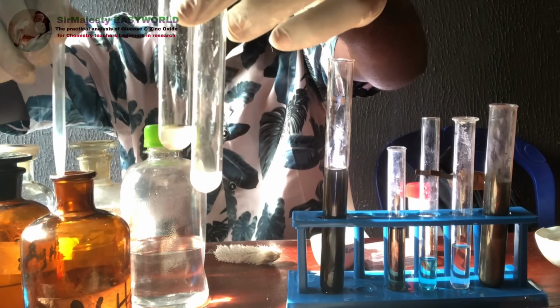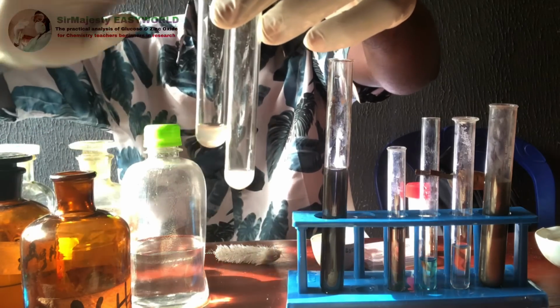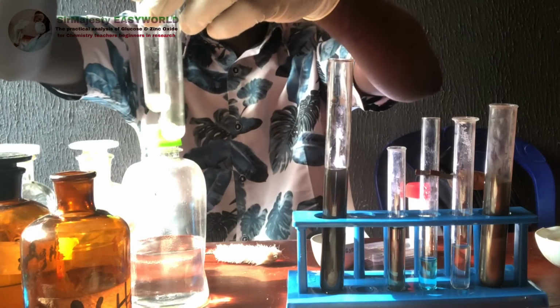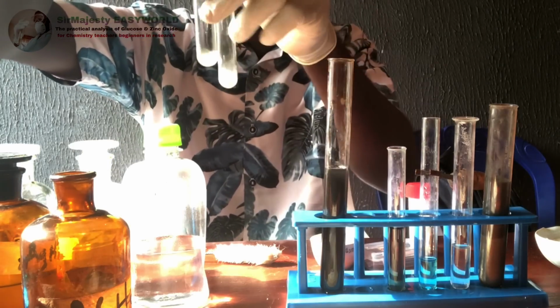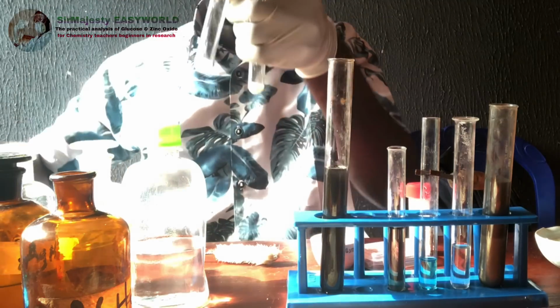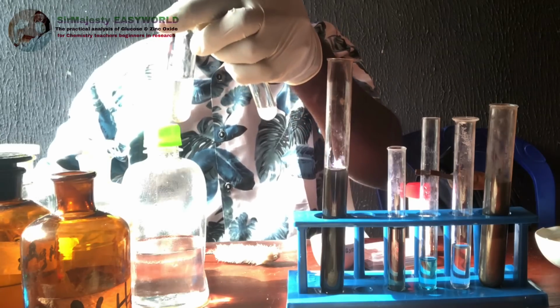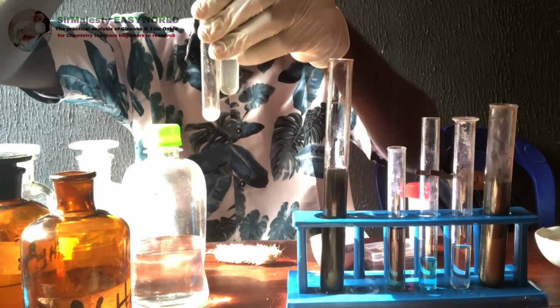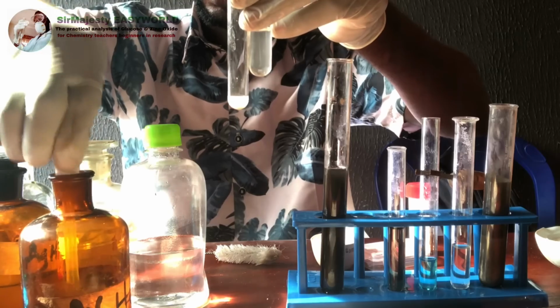So if you are required to add HCl to zinc oxide or any dilute acid, don't report effervescence, because zinc oxide will not give you effervescence on adding dilute acid, but will dissolve. So this zinc oxide, you see, has dissolved in acid. It will also dissolve in base. And then the two of them will dissolve in acid also. Even the carbonate and the oxide will all dissolve in acid.